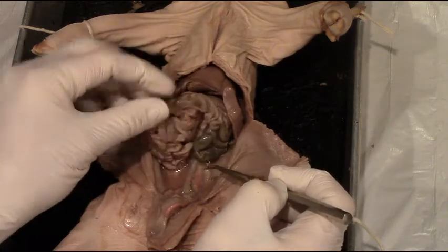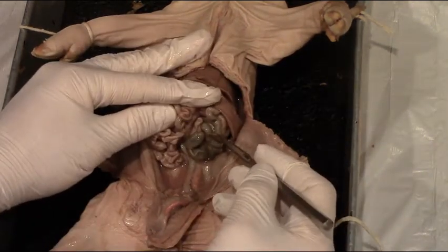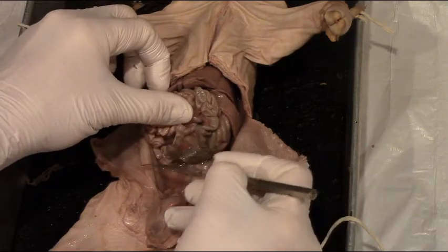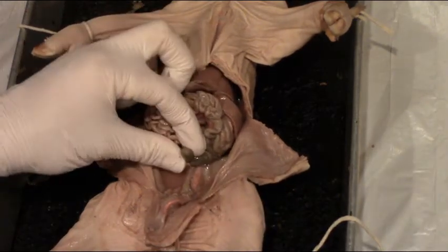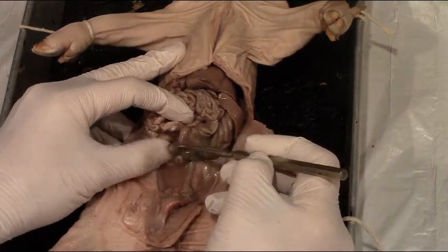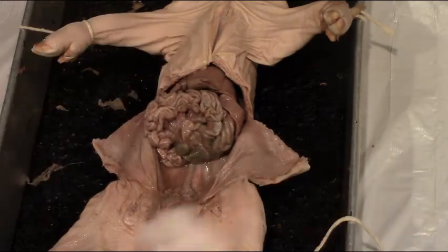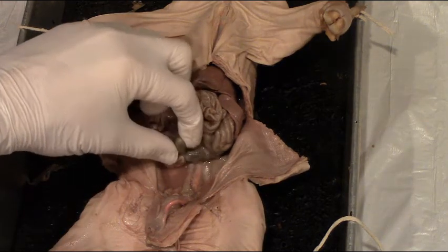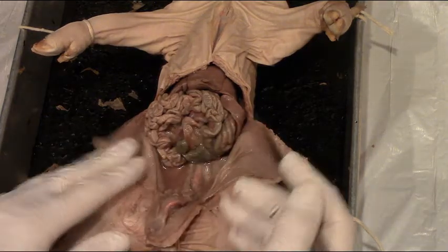The other structure to look for when the intestine is pushed up is what's called the cecum — we call it the appendix in humans, but pigs have a cecum. The cecum is kind of a dead end, usually right off of a portion of the large intestine, connected by connective tissue. By gently teasing away that connective tissue, you can see it — this pig has a really large one. For organisms with a diet of lots of grass, seed, or plant-based material, the appendix contains enzymes that help break those things down, though our appendix is no longer used in the same way.